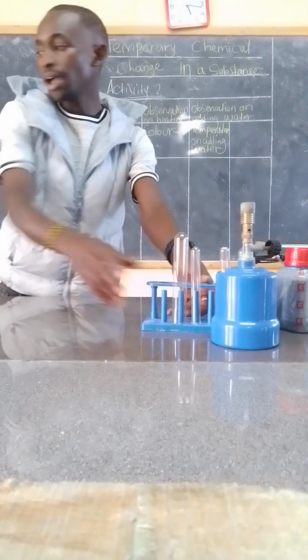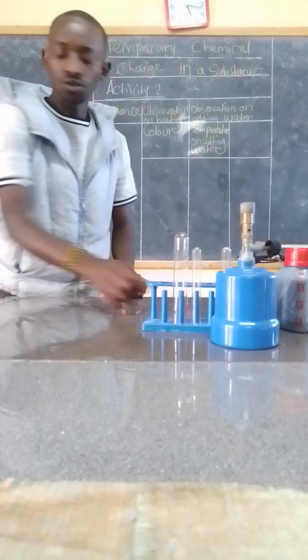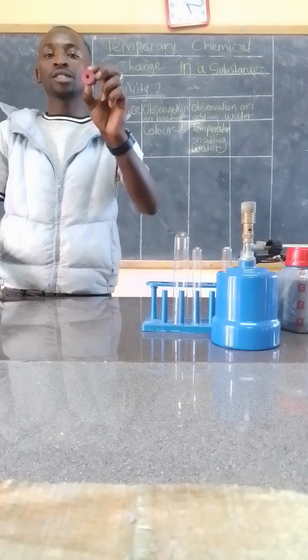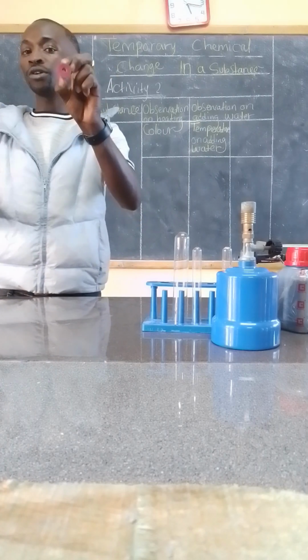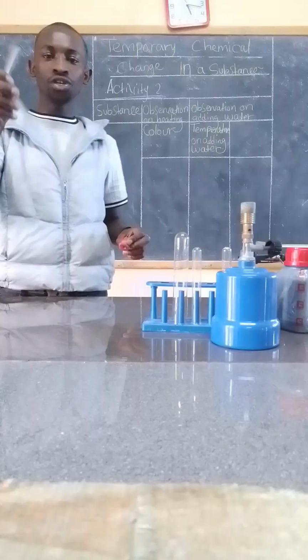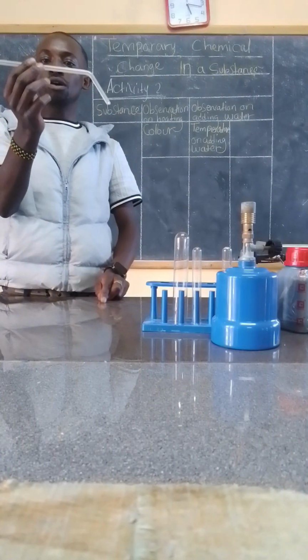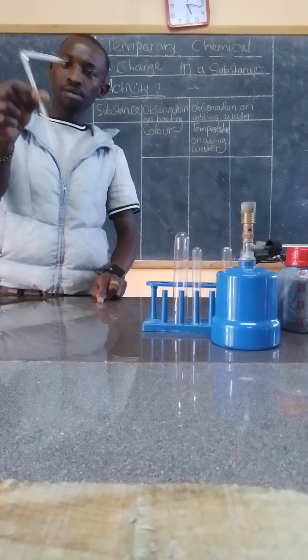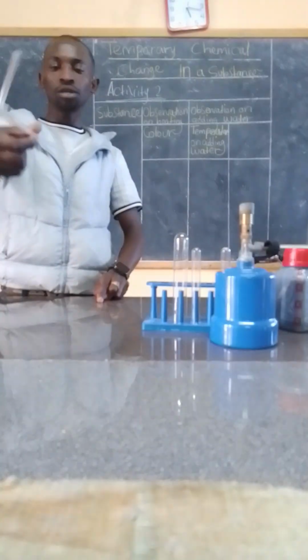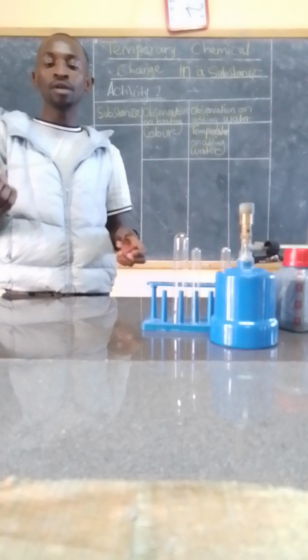You also require 1 rubber cork, and this rubber cork must have a hole. Of course, this rubber cork is for inserting into this delivery tube. So the delivery tube should be of such shape. Remember, you can make any shape depending on the apparatus you are setting up.